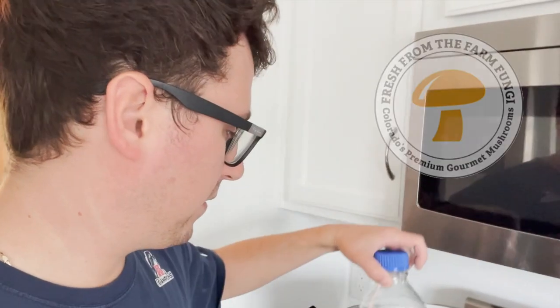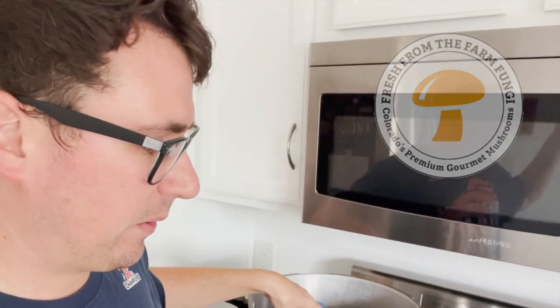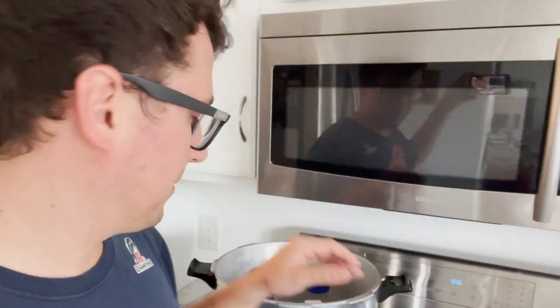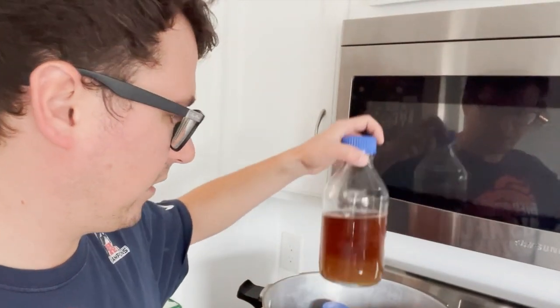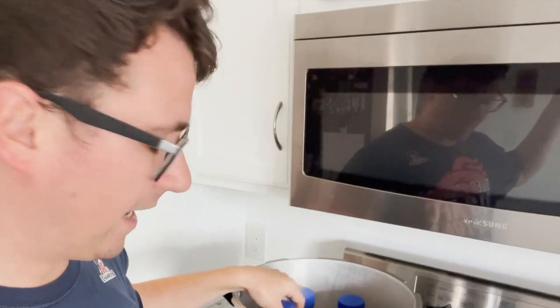What's up guys, I just wanted to do some quick tips on how to make really clean agar plates. A lot of people ask me how I get my agar to look so clear, and one of the key tips that I like to tell people is to clean out these jars really well. So any debris that would be left in your media bottle before you pour your clean agar into is going to get contaminated.